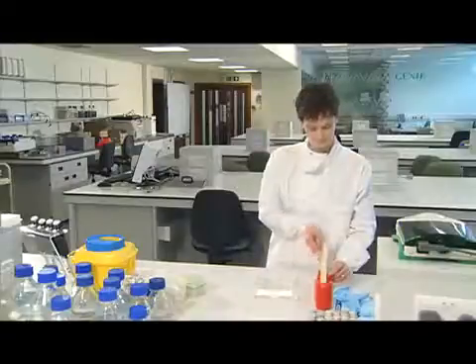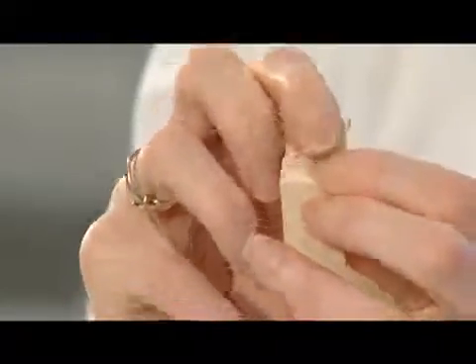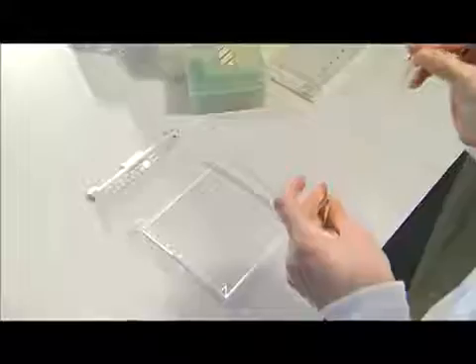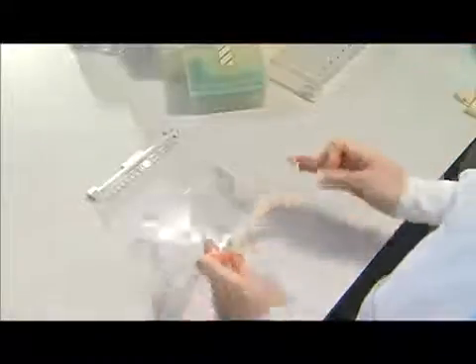Gel trays have two open ends that need to be sealed while the gel is solidifying. This is easily achieved using masking tape. Take a piece of masking tape that's a few centimeters longer than the open end of the gel tray and fold over one end of the tape to make it easier to remove later.